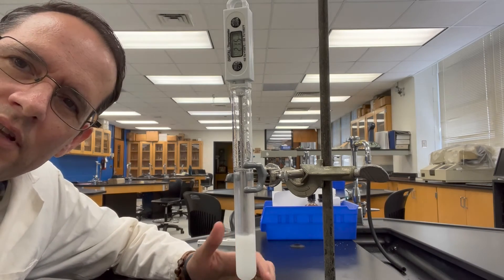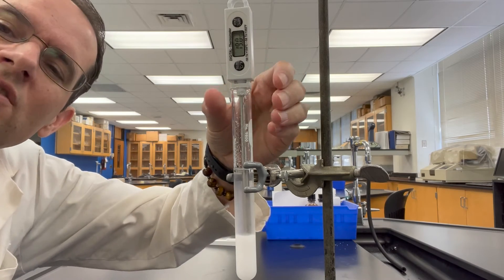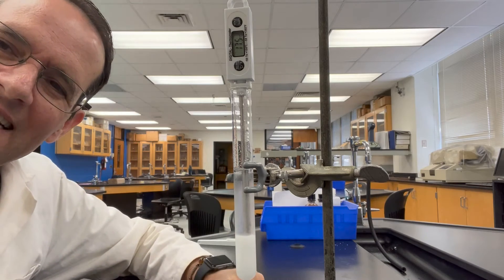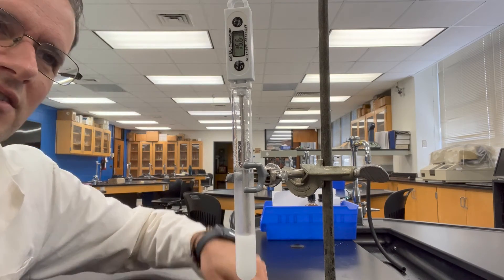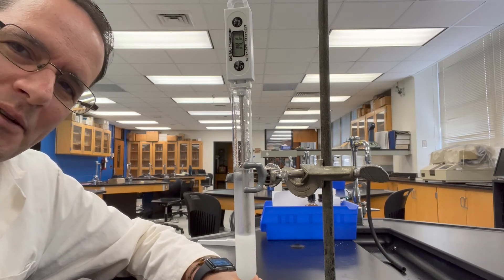It's not critical that you measure the temperature — just pretend like you're touching this test tube. Would it feel hot or would it feel cold? I'll just let it run for a bit because probably the dissolving process takes a little bit of time.